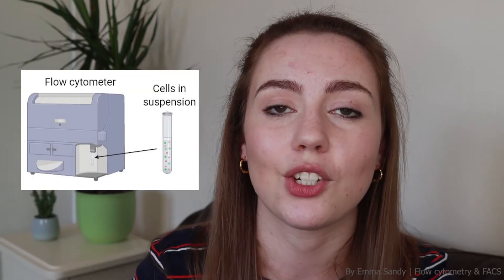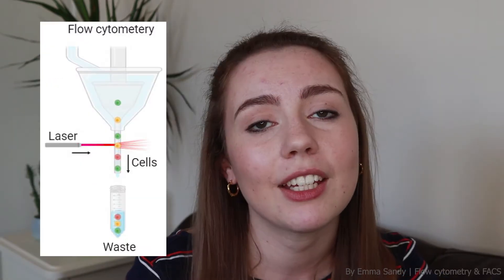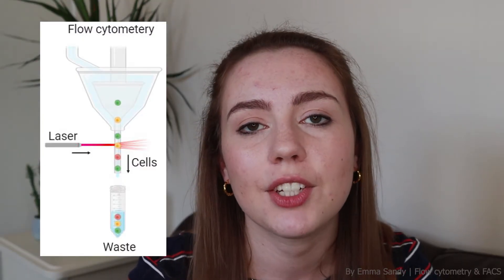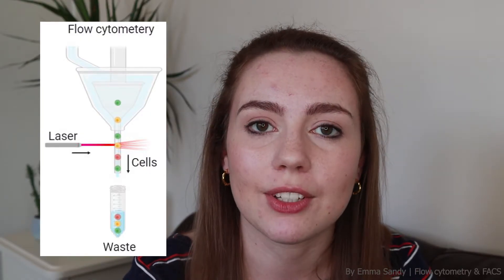Flow cytometry is a way that biologists are able to analyze and count cells. It's super handy for immunologists to be able to study immune cells, but it can be used to study a lot of things such as the cell cycle, cancer cells, bacterial cells, or even microscopic parasites. Flow cytometers are the machines that do the work. They take a sample of cells that are in suspension, which flows through the machine — hence the name. Everything in flow cytometry works by light and lasers, and by shining lasers on each individual cell and collecting the light that comes off, we can build up a picture of what each individual cell looks like.